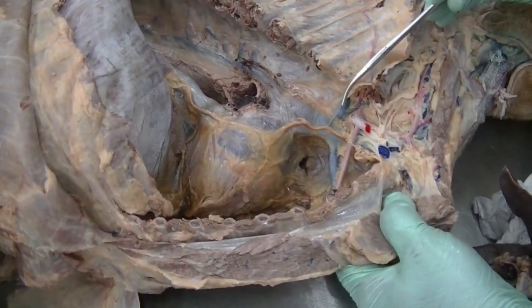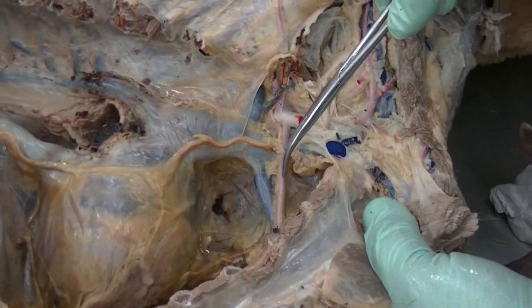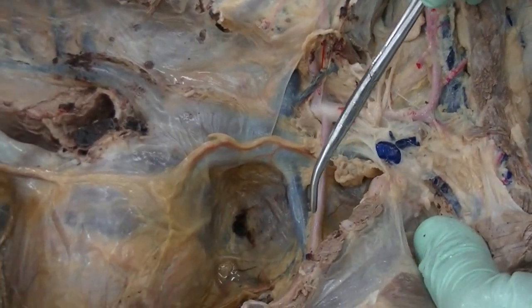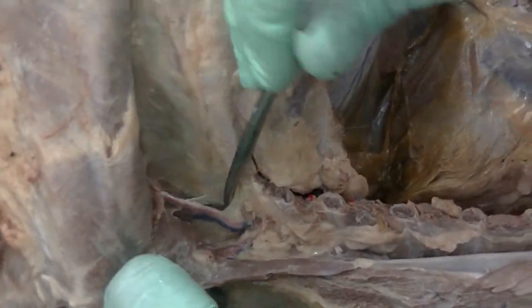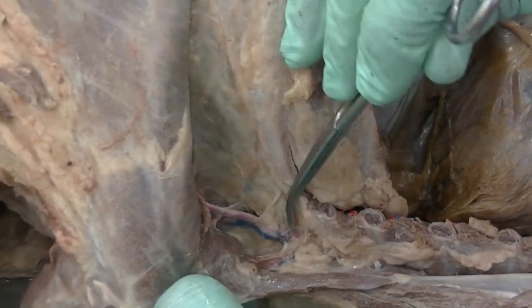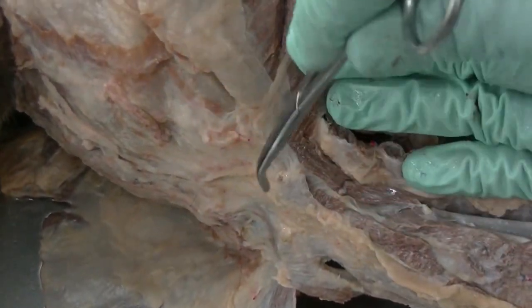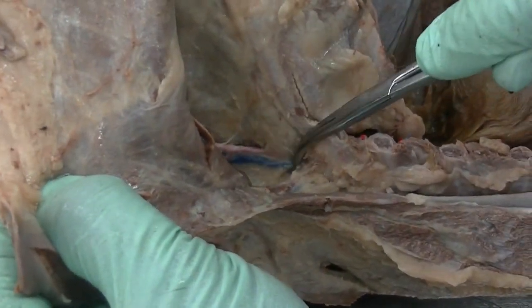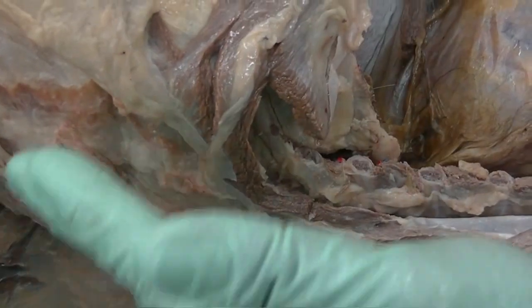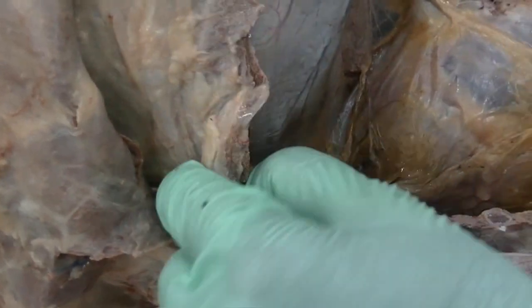Okay. Some of the other features that we see are the right subclavian artery and the right internal thoracic artery. The same branches as we saw on the left side are going to be present here. We see further continuation of the internal thoracic outside the thoracic cavity as the cranial epigastric artery, and coming more superficially on the body wall just below the skin is the cranial superficial epigastric artery, which is also accompanied by a similar vein. So we have the cranial superficial epigastric artery and vein, and the cranial epigastric artery and vein, which is present outside here.